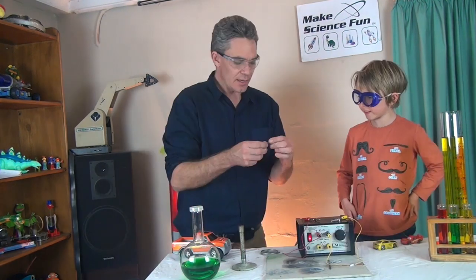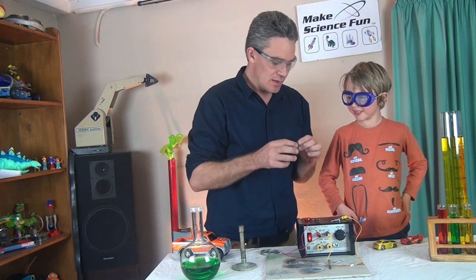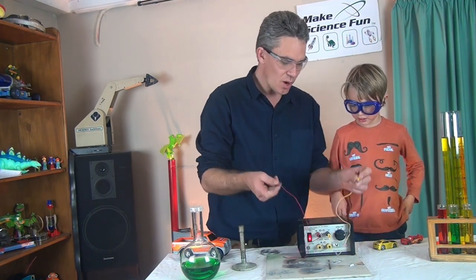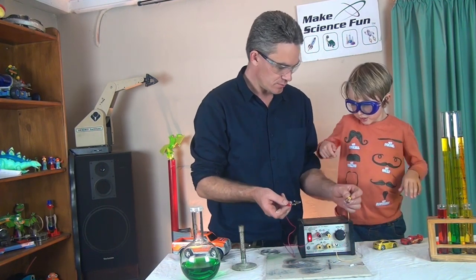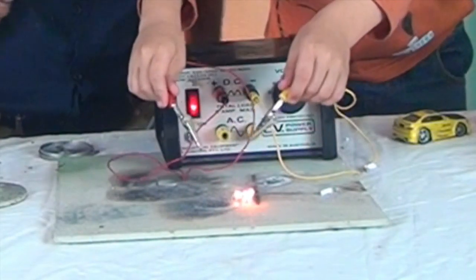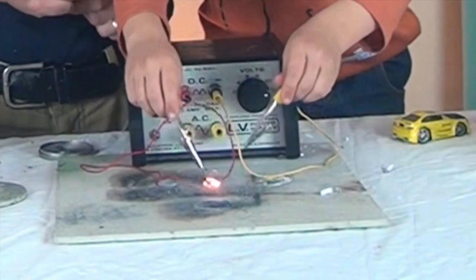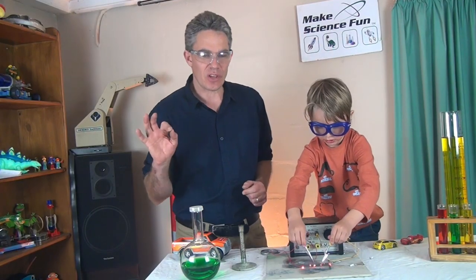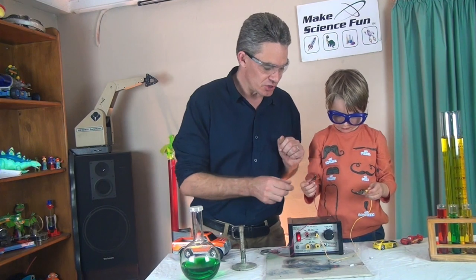So that's magnesium, Sam. And iron wool is made out of the metal iron. And you know what? That's slightly flammable. And it conducts electricity as well because it's a metal. Sam, what I want you to do is touch the wires to each end of the metal. Here you go. You touch it to the two ends. Look at that. Iron metal actually burns. It burns with an orange fire. It's very fine metal though. And it's turning into iron oxide because it's reacting with the oxygen in the air.